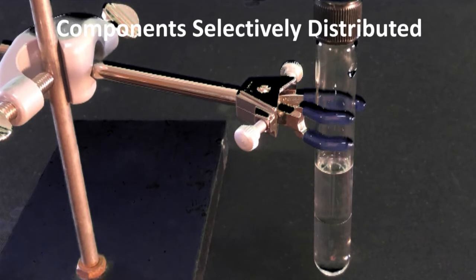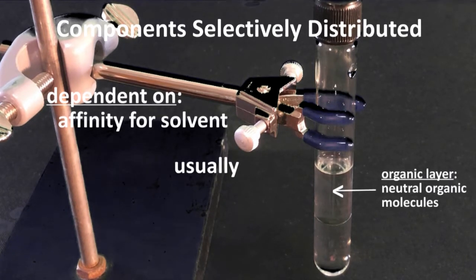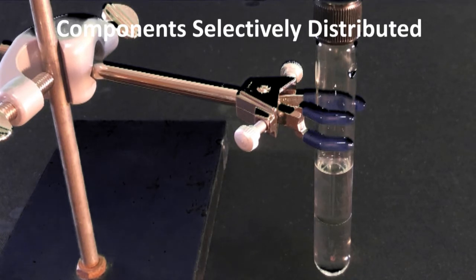The different components of the mixture are selectively distributed in one solvent or the other, depending on their different solubilities, or their affinity for one solvent over the other. In most cases, but not all, neutral organic molecules prefer the organic phase, while charged molecules and inorganic salts prefer the aqueous layer. As you go through this workup process, be sure to keep track of the layers and which layer you want to keep.